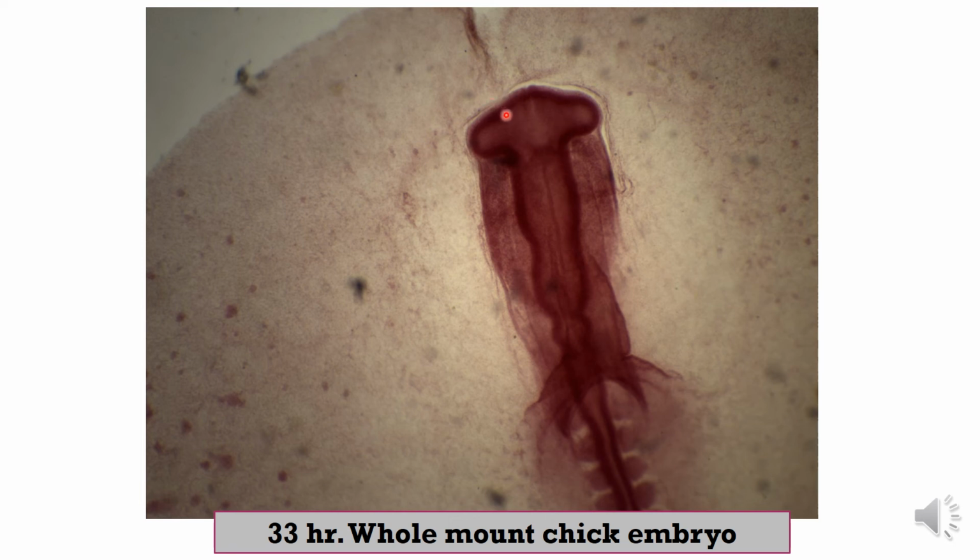Here you can see the brain vesicles, and the opening of the neural tube anteriorly is called the anterior neuropore. Anterior neuropore. You can see this region that is the opening, we call it the anterior neuropore.